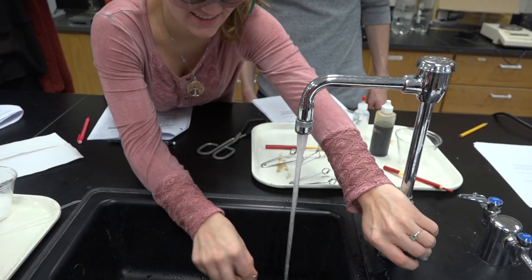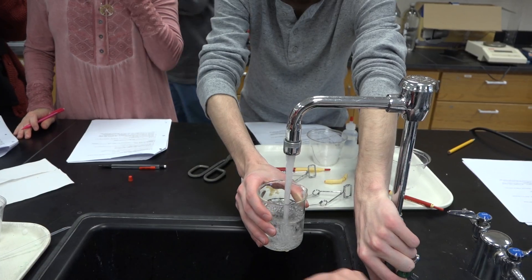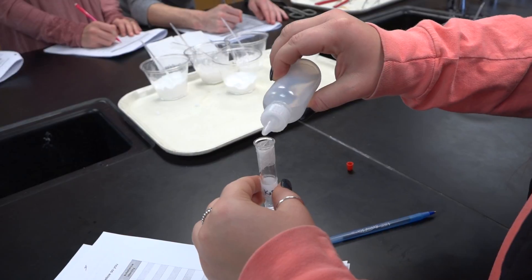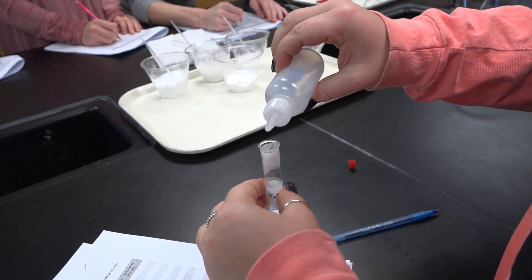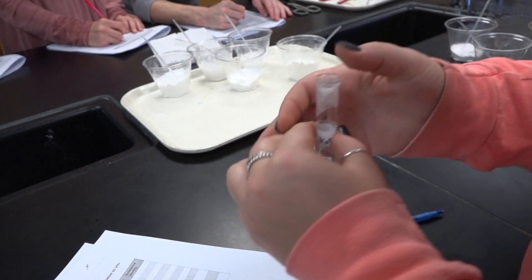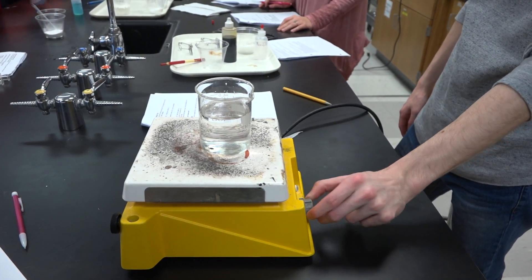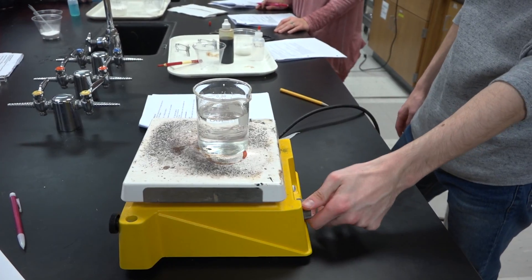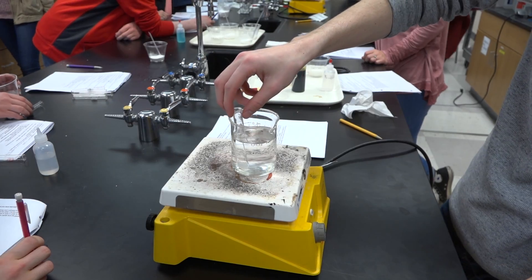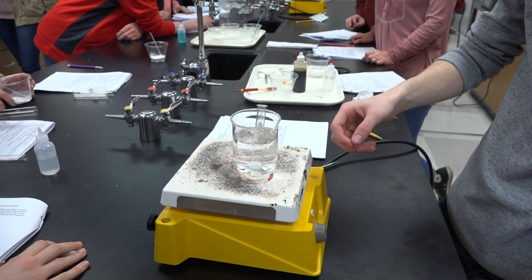We're doing the copper sulfate test, where we put fructose and sucrose into test tubes, add some liquids, and heat it up to see if copper metal forms in one of them. That will help us find out the identity of the substance, which will help us in our future lab.